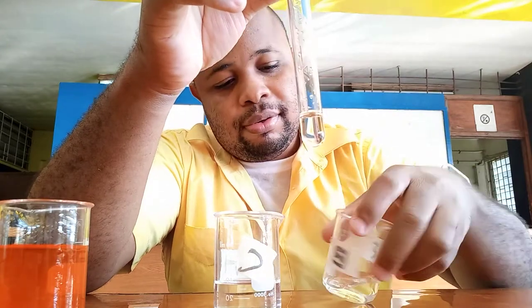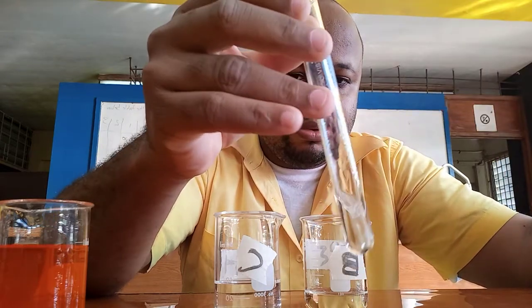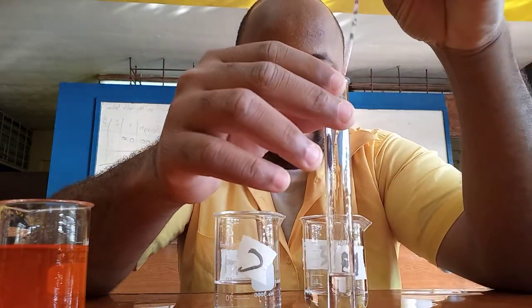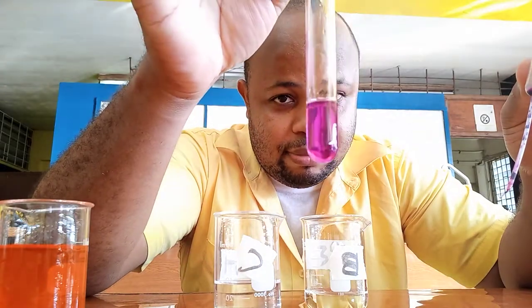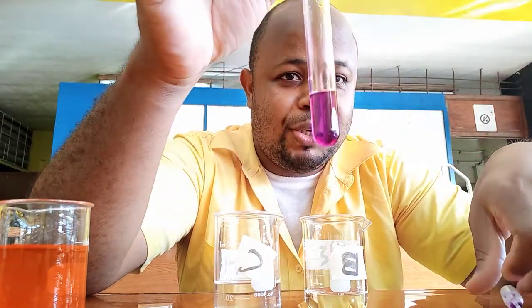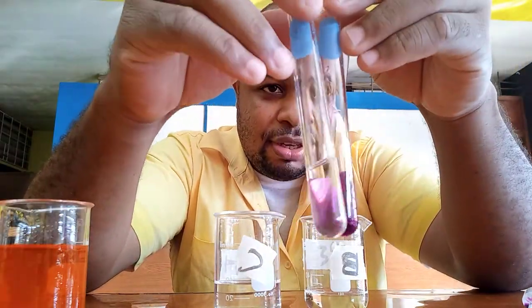Now for the next alcohol. I add the sulfuric acid, then the potassium permanganate. It's purple — and nothing is changing. That means this is our tertiary alcohol. The potassium permanganate remains purple and does not decolorize.